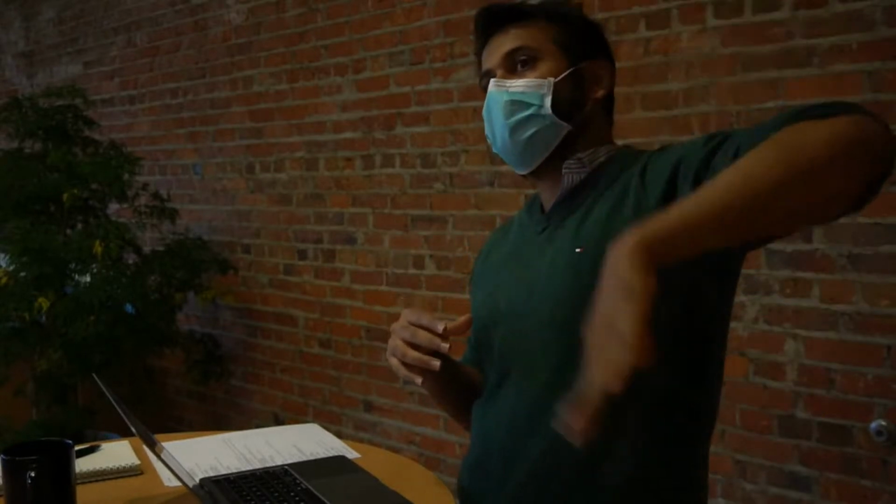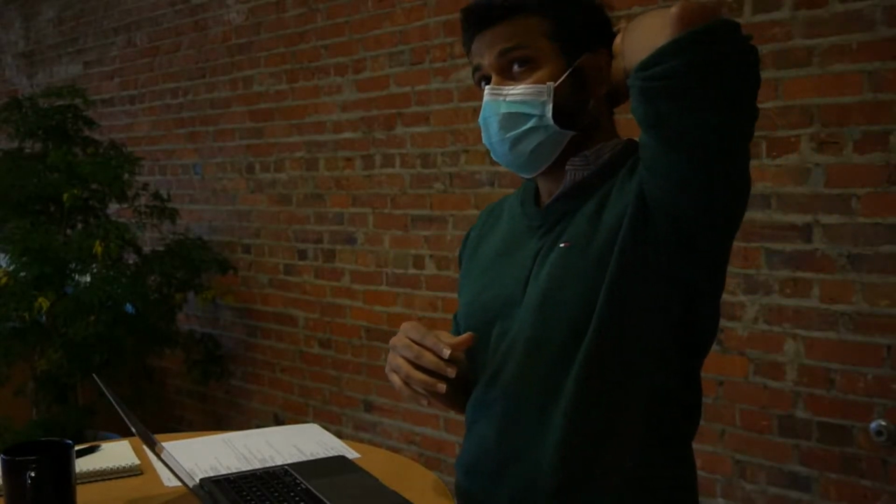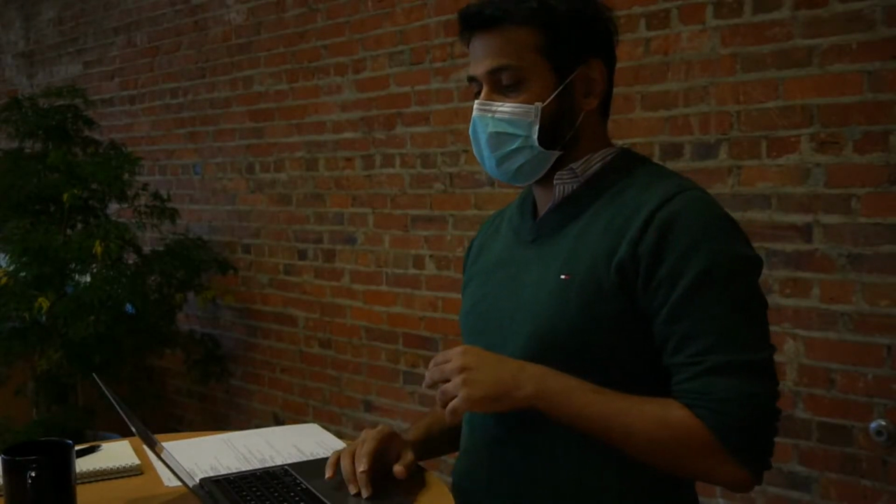But even those developments, I mean, they are pretty intuitive, but they don't work very fast. So when you apply it to genome scale data, those functions can really slow down. So for that, we will again rely on some base R approaches.